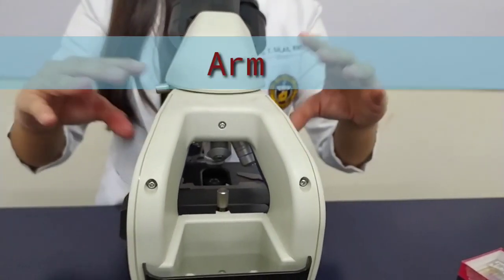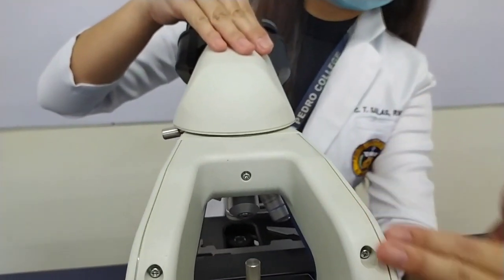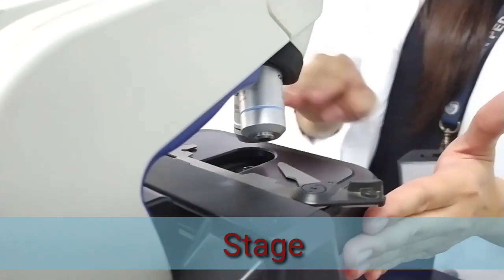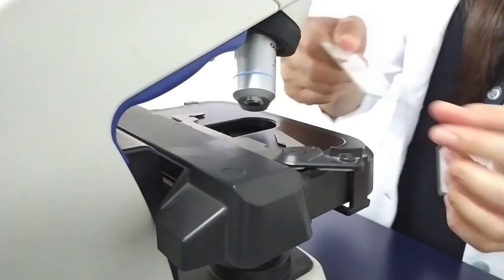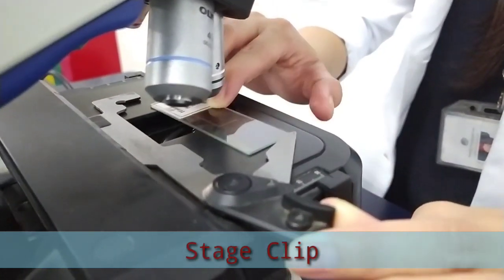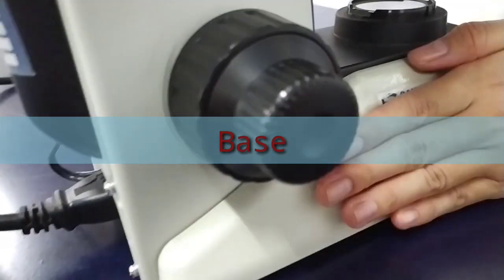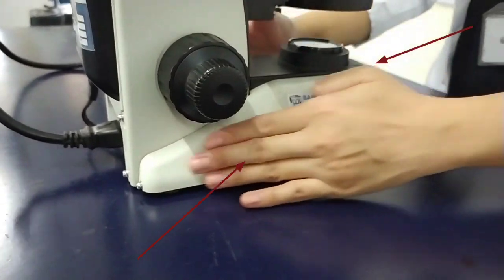Arm. It supports the tube of the microscope and connects to the base of the microscope. Stage. The platform that is flat, used for placing the slides under observation. Stage clip. Stage clips hold the slides in proper place. Base. Provides basal support for the microscope.